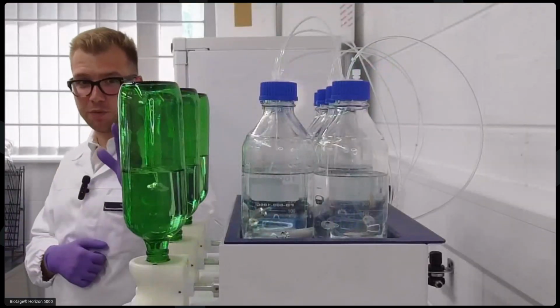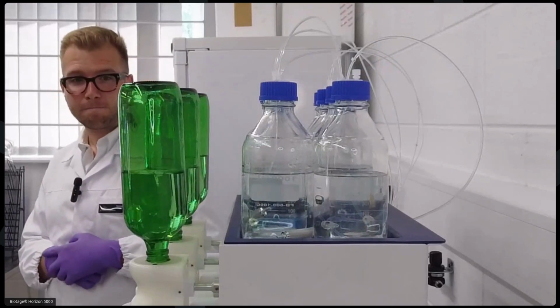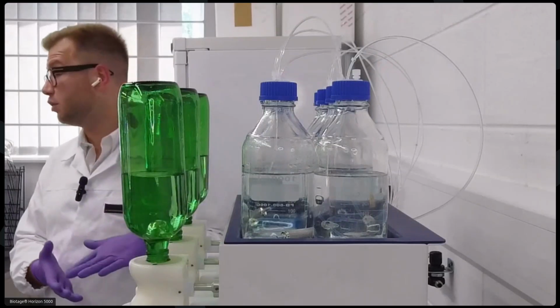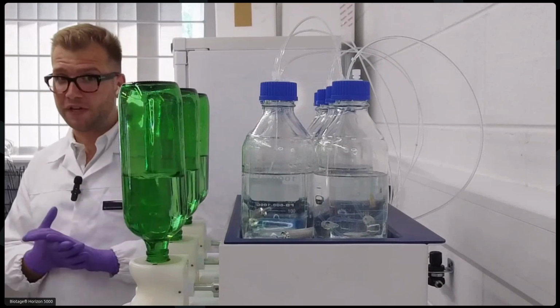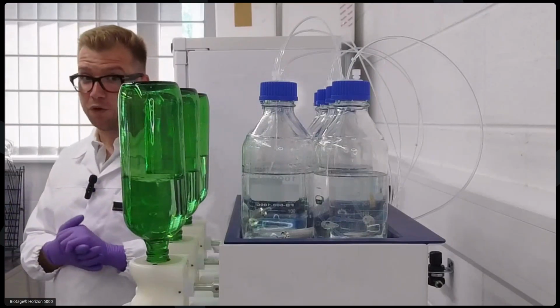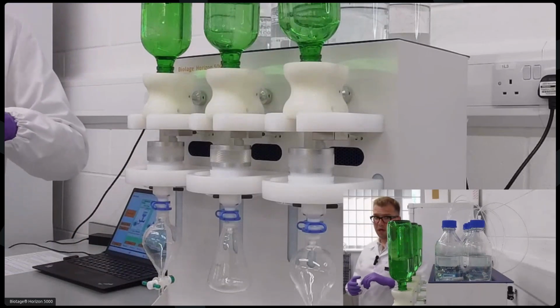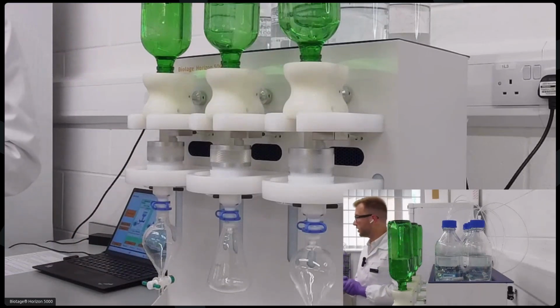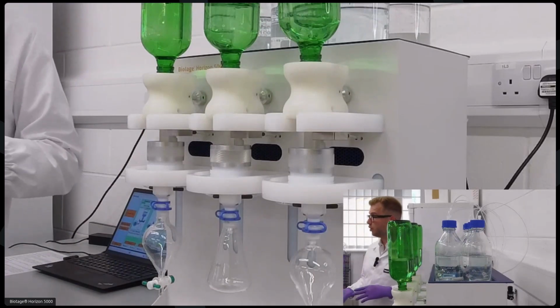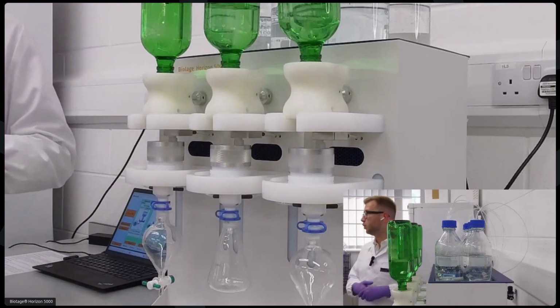As you can see, we have the samples loading. And in this case, using the disk allows a much faster load rate. You will see that this half a liter sample will get processed in about 2 to 3 minutes. Now, of course, for the purpose of the demo, we have clean samples here. However, if something you're working with is wastewater samples, very dirty matrices, this is something we can arrange a demo with you specifically. You can send samples in, and we can show you exactly how the system would work with your samples.